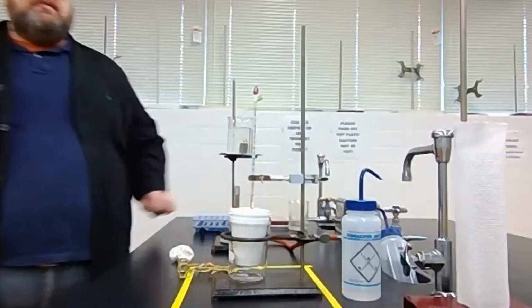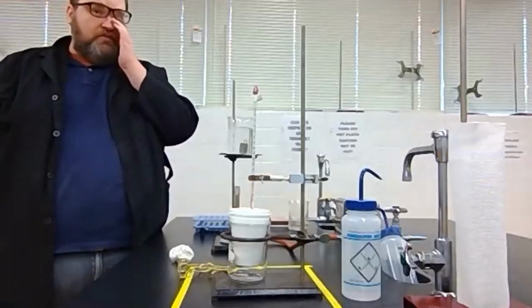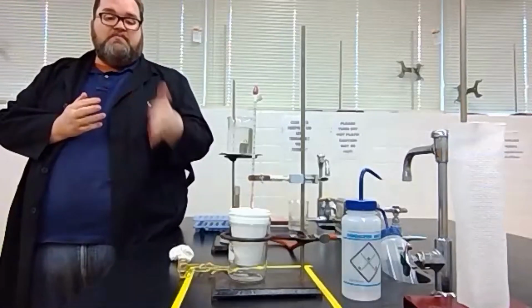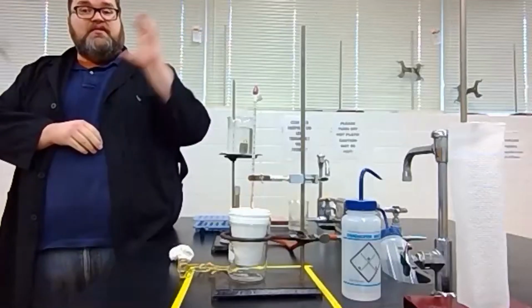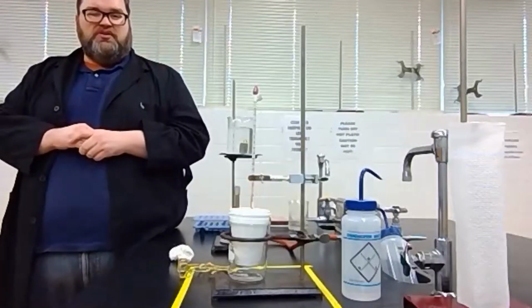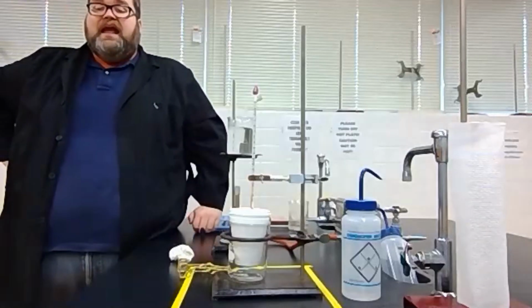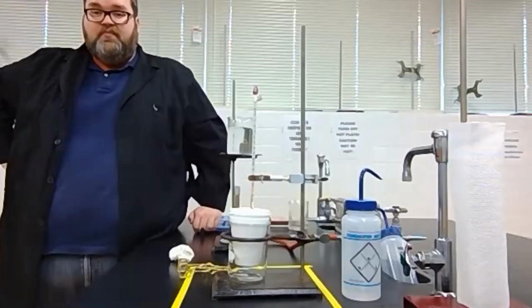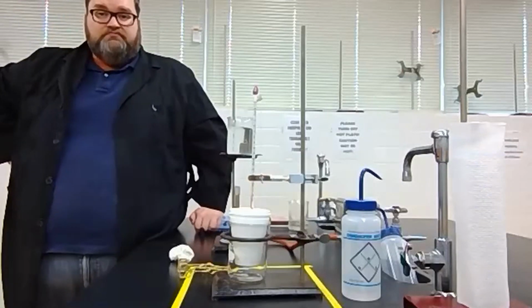Okay? I did the same thing with the coffee cups, but I did water instead of the metal. So I took my 2 coffee cups, obtained their mass, then added water, filled it up about 2/3 of the way with DI water, gotta be specific here, DI water, and then weighed it again. Okay? You'll be provided the mass of both the metal and the water.